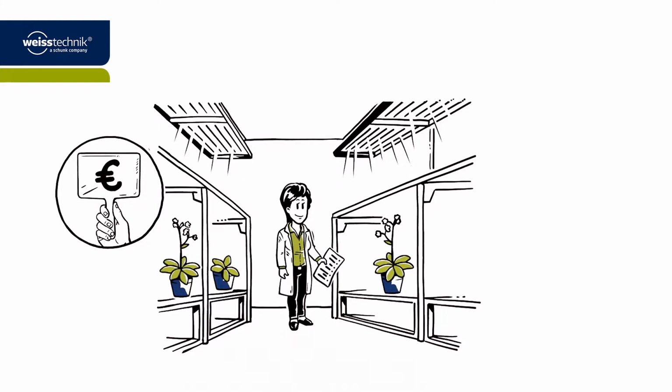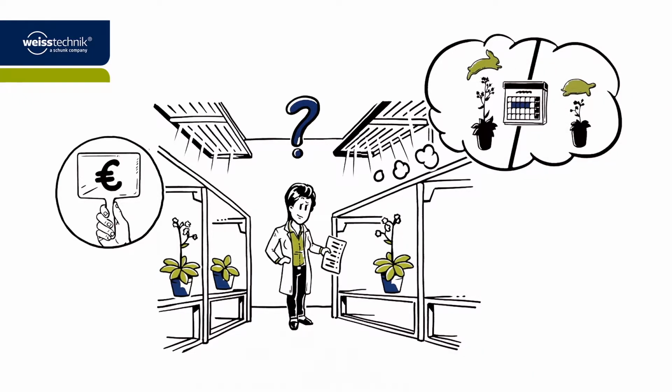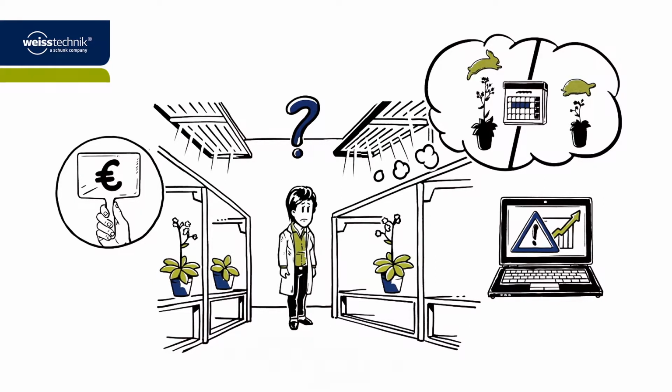When it comes to the specifications, however, two frequently occurring problems lead to a number of questions. Why do the plants grow slower in some rooms than in others? And why do plants of the same age grow to different heights in some rooms despite being exposed to the same amount of light? When Dr. Wagner wants to evaluate her experiments, this proves to be a real shortcoming.